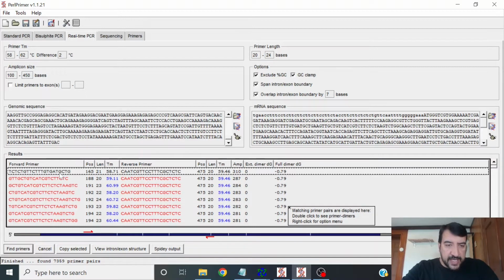And so when I click this one, you'll notice that on this diagram down below, it shows me where the two primers are. And you'll notice that one of the two primers right here spans two exons. And so this primer wouldn't do a great job of binding to genomic DNA because half of it is in one place of the genomic DNA and another half is in another part of the genomic DNA. But when you remove that intron right there, then these DNAs are next to one another. And so that's why this is good for qRT-PCR.